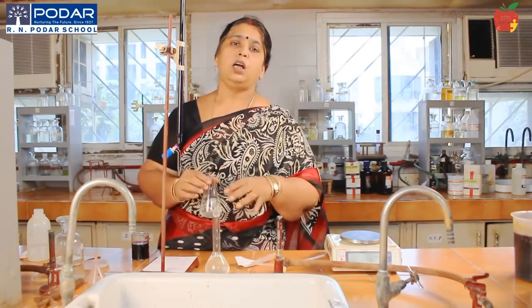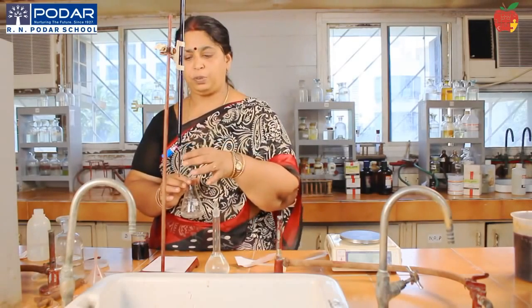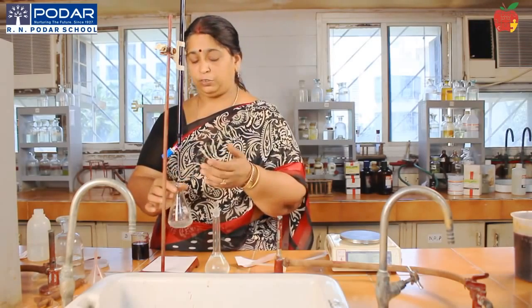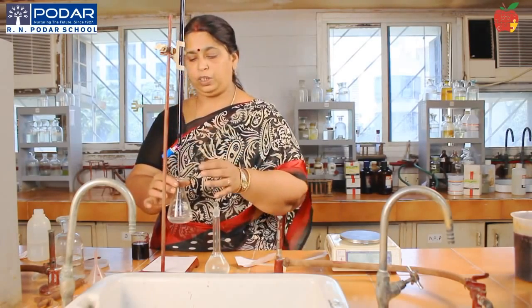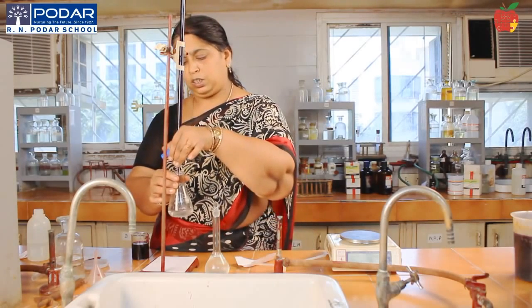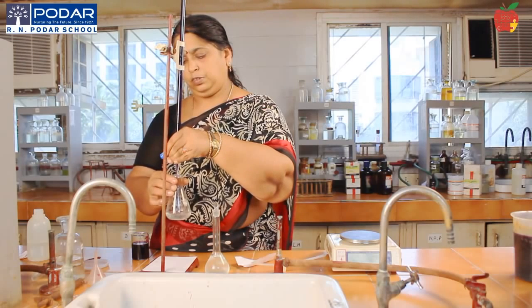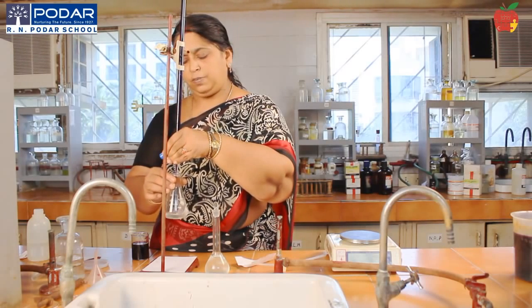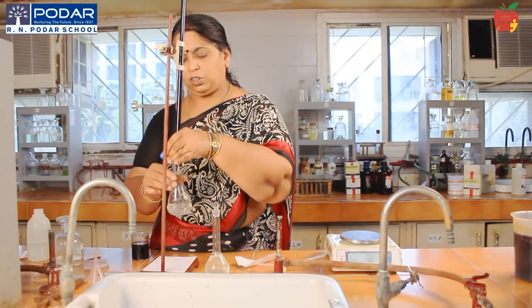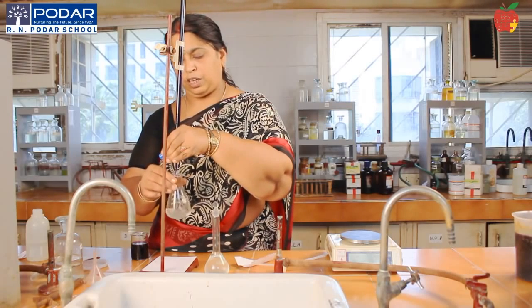Okay, now I have to start the titration. Your both hands should be engaged. Open the nozzle of the burette from the back side, whichever is convenient, left hander or right hander accordingly. You open the nozzle of the burette and then go ahead adding drop by drop, with continuous shaking, and the drop should exactly fall inside the solution, not on the sides of the conical flask. You should be able to control the flow from the burette.